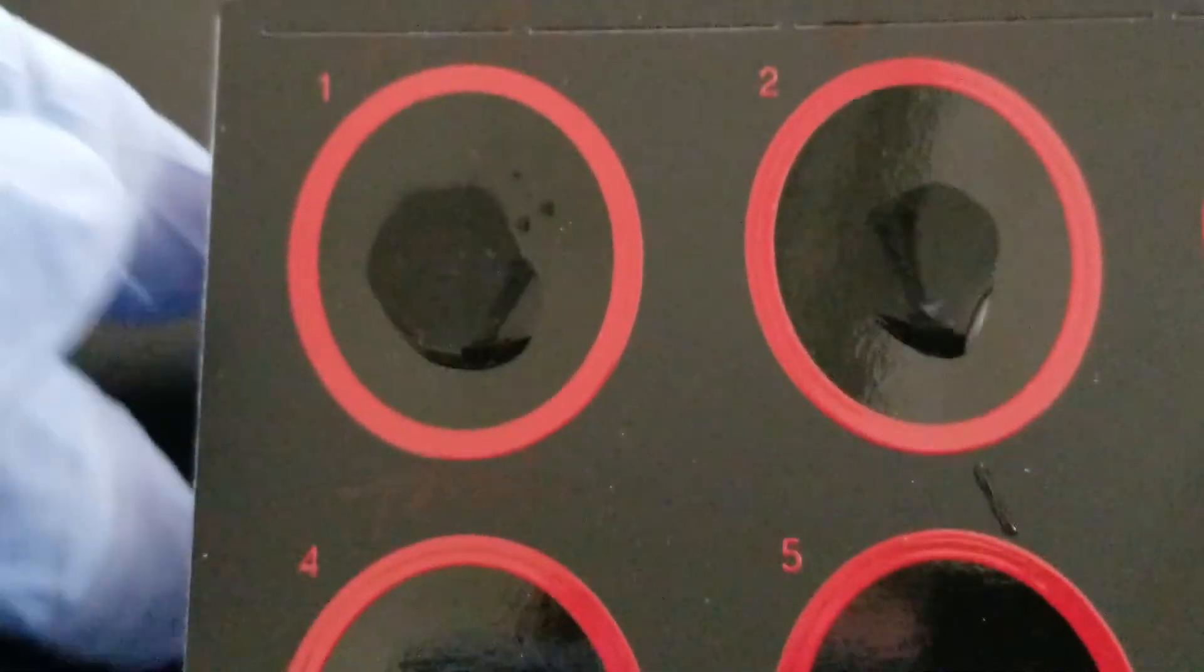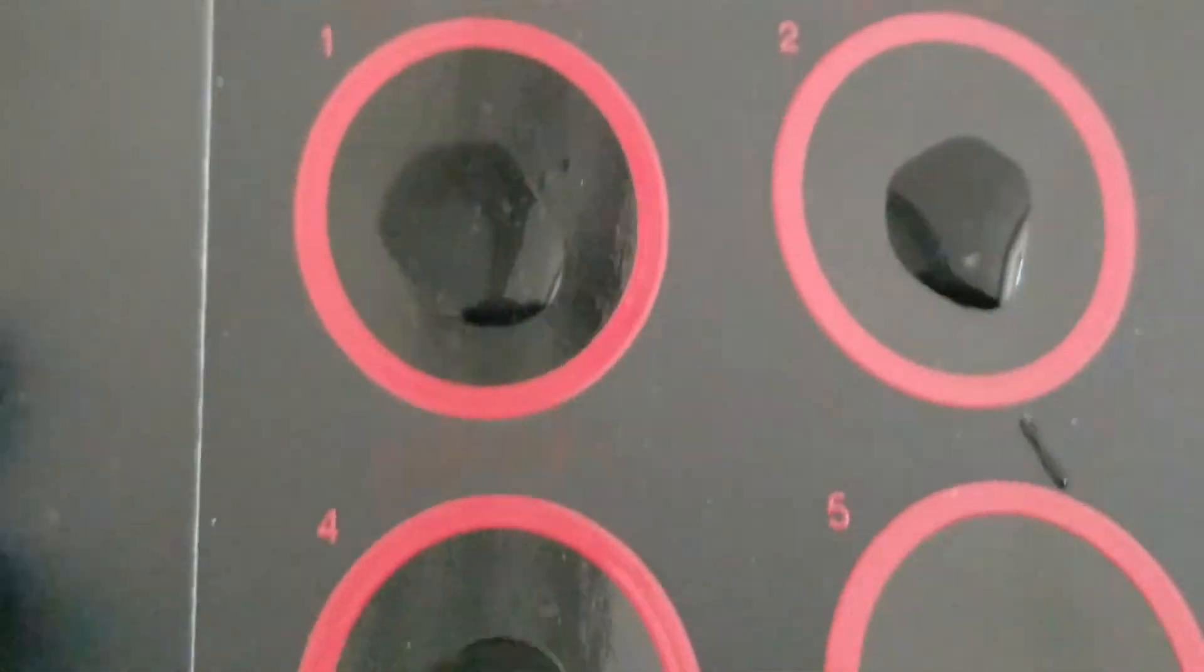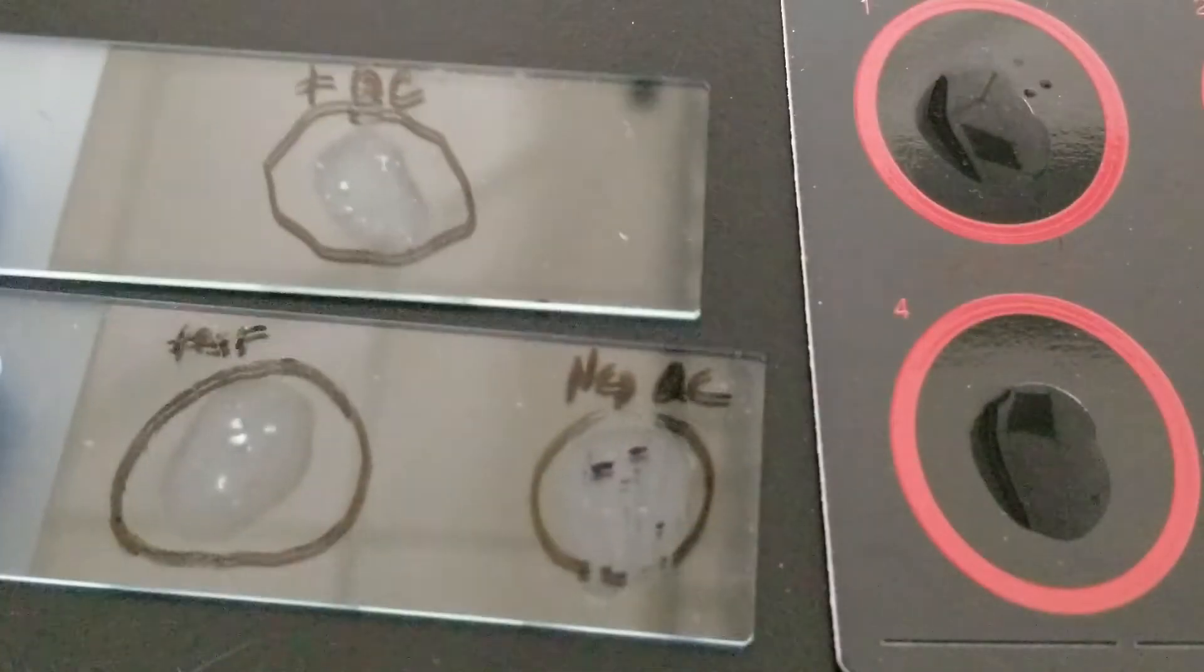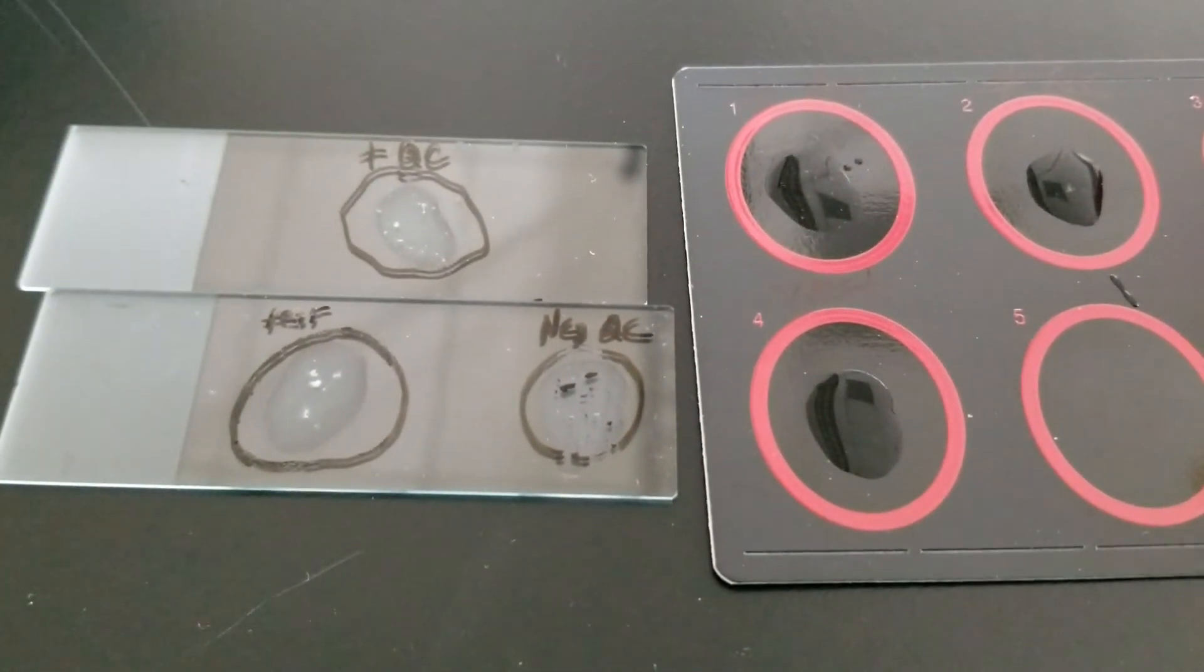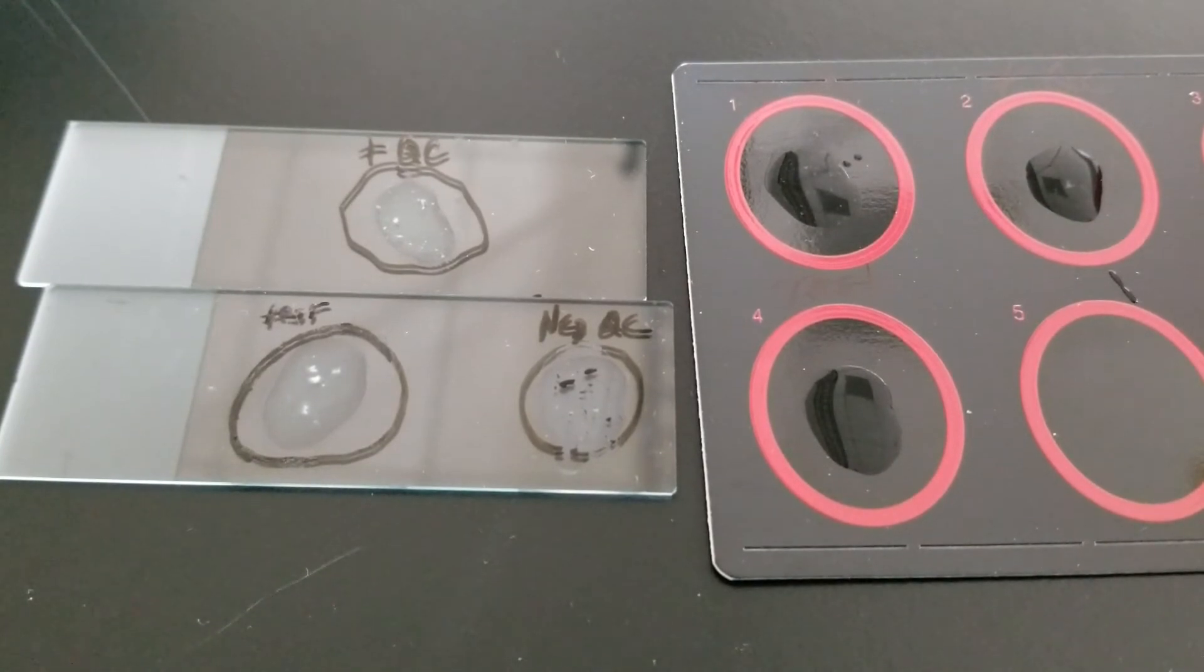We're going to rotate it. This should be 5 to 10 seconds again. If you'll notice the positive QC is clumping, the negative QC just kind of stayed where it was, it didn't really clump. And this bottom one here, there are some clumps in there, but you can't really see them very well on the camera. The bottom one is supposed to be positive because I put Staph aureus in there too. I just don't think much of it came off of my loop, but you can see there's a few in there. This is what it looks like on the test kit slide. So you have the microscope slide versus the test kit slides. You can use whichever one want. Either is fine and hopefully you'll get the right results.